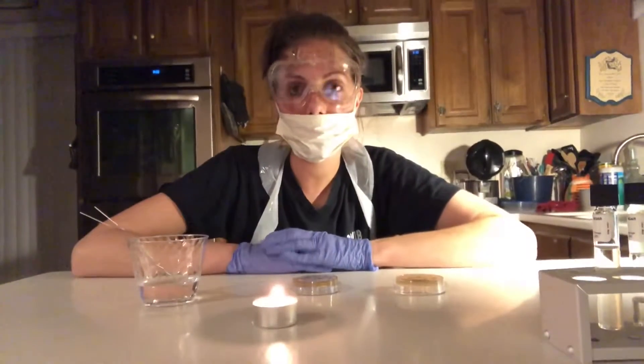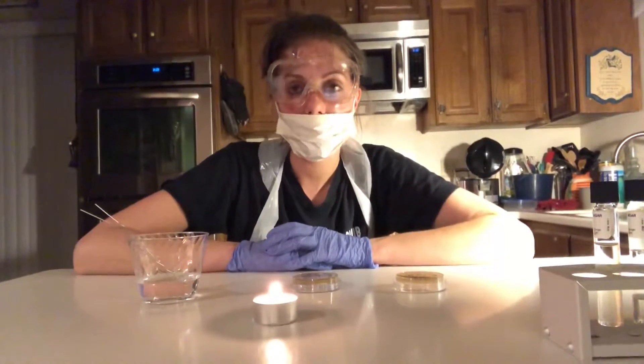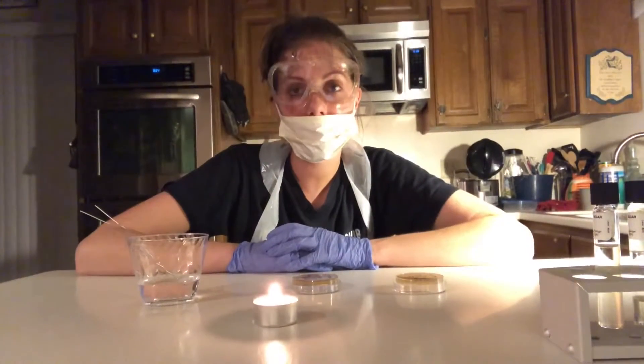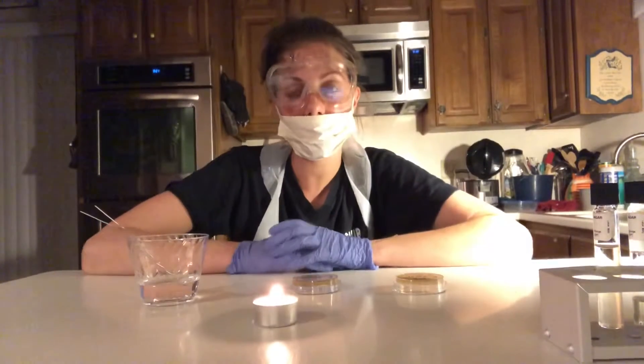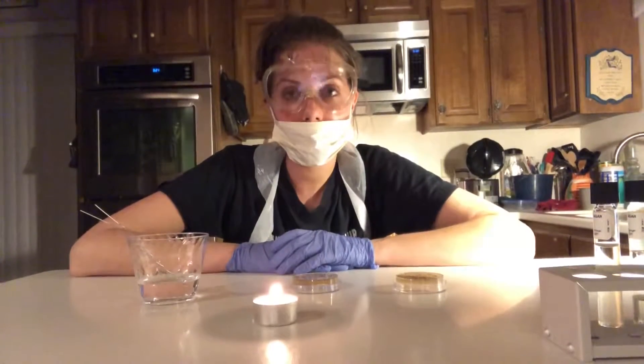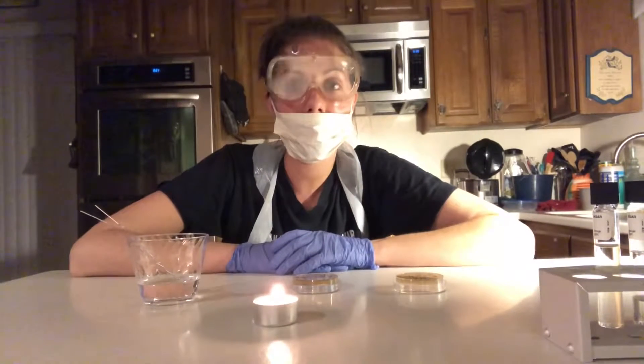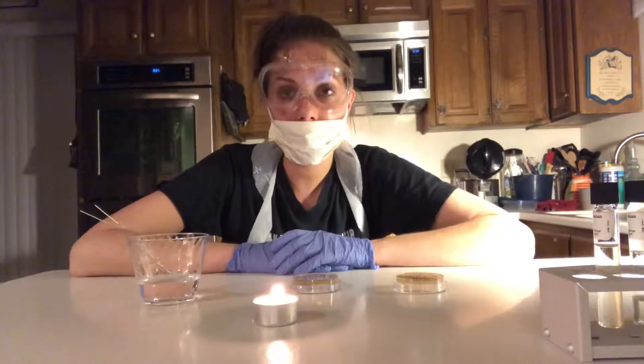Hello Professor Stancil, this is Kristin Madla and today is Tuesday July 23rd. Today I'll be starting the bacterial identification through functional media lab, and I'm basically going to be conducting a motility test. I'm going to start by prepping the motility media tubes.